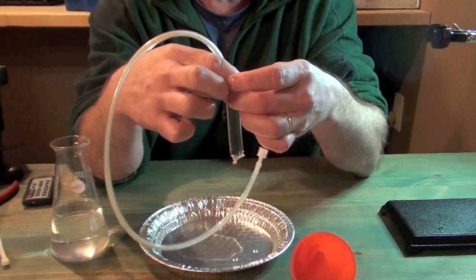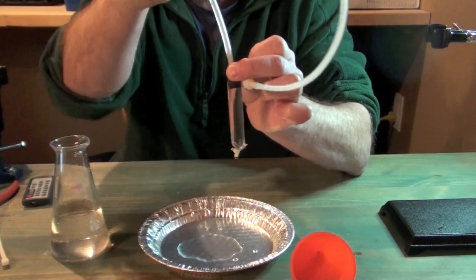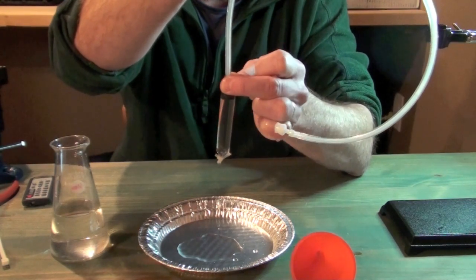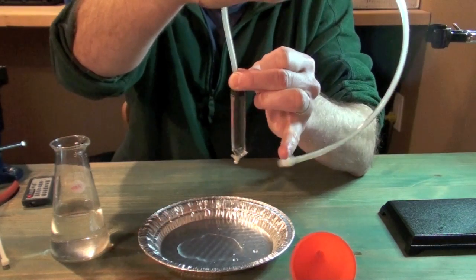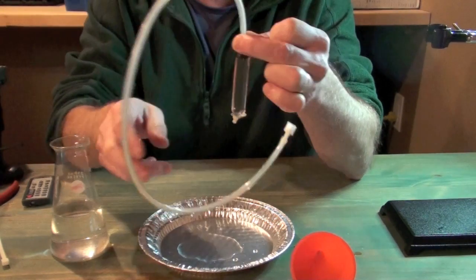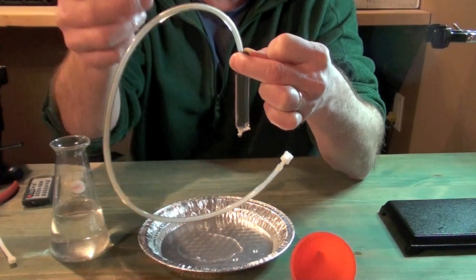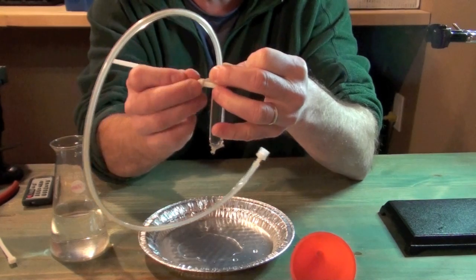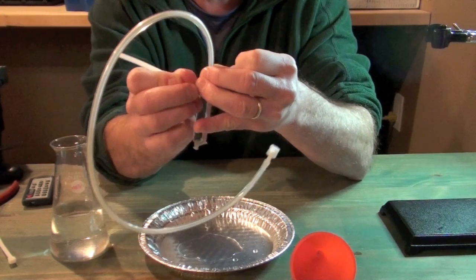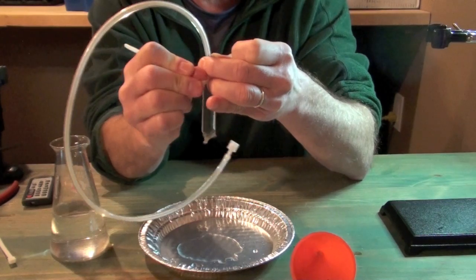Now again, we've got a situation here where a textbook would normally ask you to take a piece of string and tie that off. But what I'm going to do is stick with my handy dandy zip tie method. I've got a slightly bigger zip tie here, so I'm just going to slide that up over the tubing and then over the stopper and then tighten my zip tie, just like that.